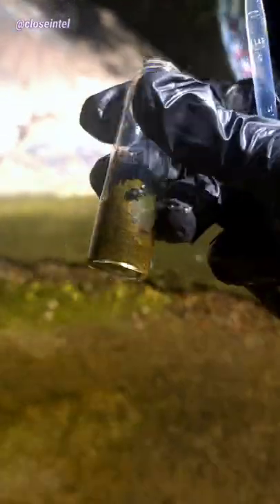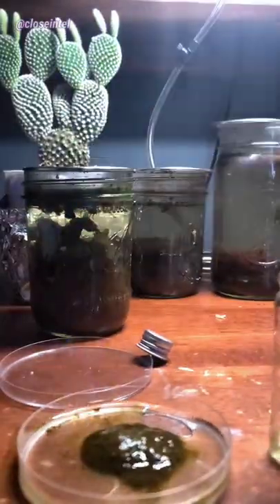I've only showed you this creek once before to show you how to collect diatoms. Most of the brown algae you see in flowing creeks is actually entire colonies of them. After collecting a bunch of the brown goop, I went back and put it in a petri dish and spread it out with a pipette. You could also just use a strainer and squeeze the algae.